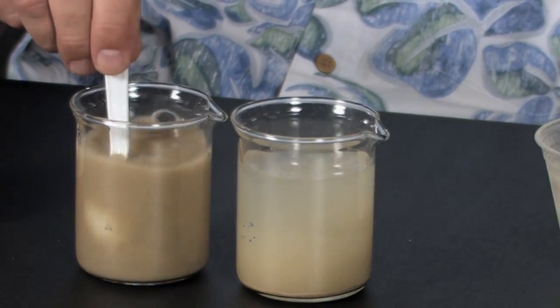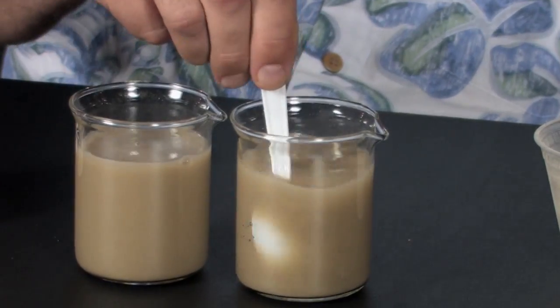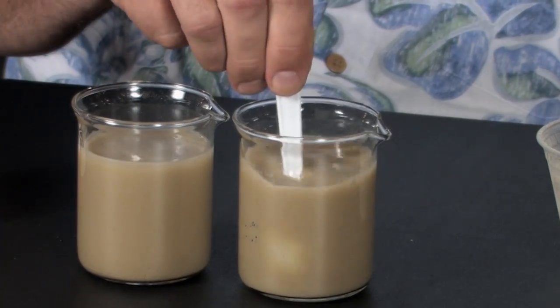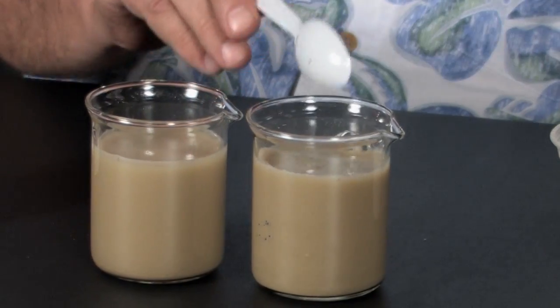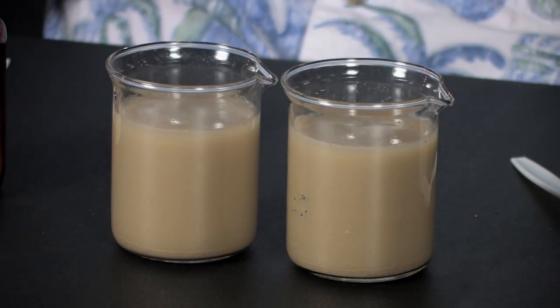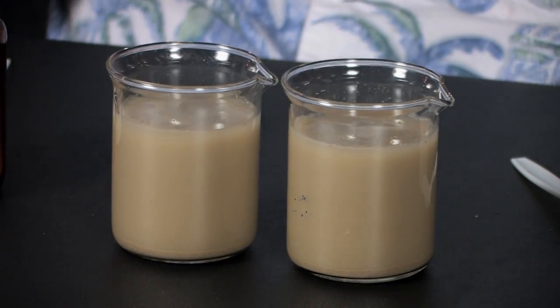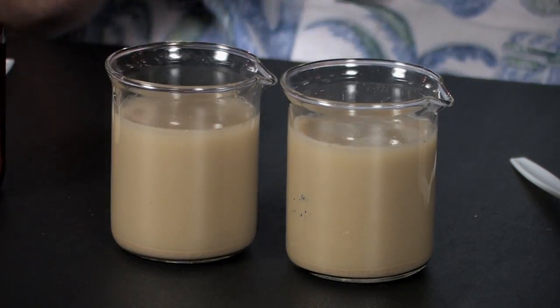Stir it up and you'll see that it looks like chocolate milk. What's happening is the clay particles are dispersing, and they won't settle out because they're too small for gravity to pull them out of solution. The water molecules are moving around and will keep the clay particles suspended because the soil is dominated by sodium.